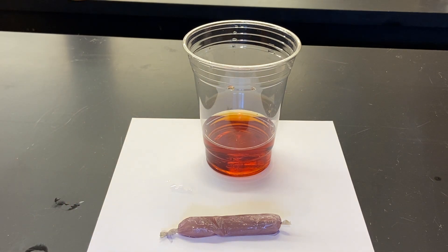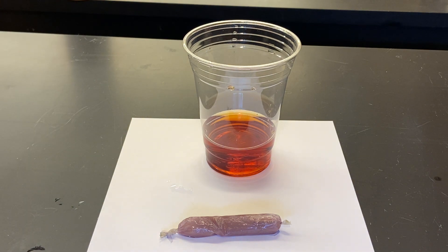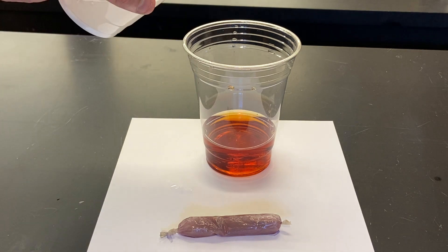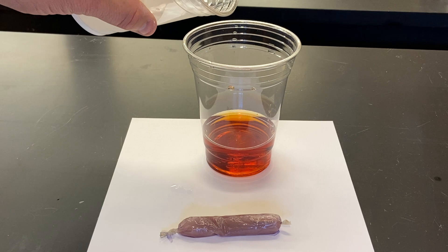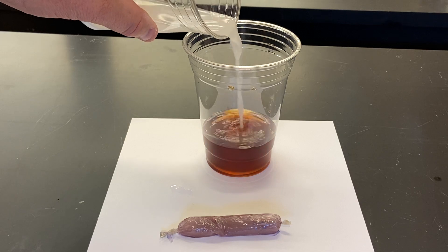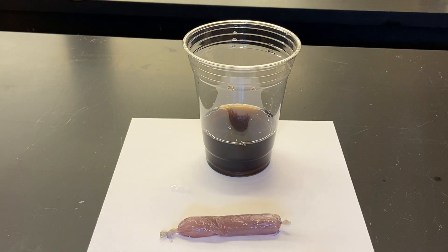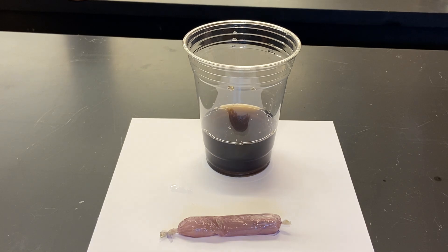If starch had come out, I'll give you a demonstration — this is not part of the lab, but I want to show you. I'll put some starch solution in there so you can see what happens when starch hits the lugol solution. It turns it black. So obviously starch did not leave the cell, glucose did leave the cell, and iodine actually went into the simulated cell.